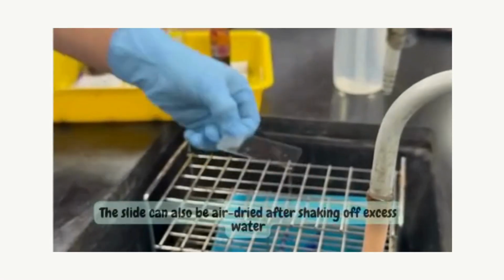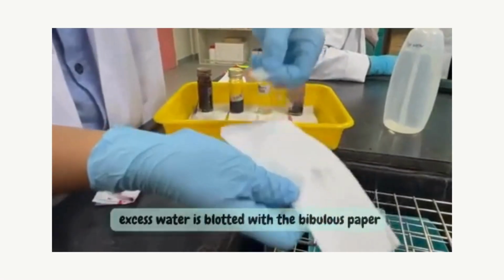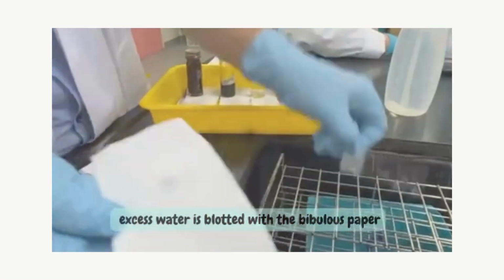The slide can also be air dried after shaking off excess water, and excess water is blotted with bibulous paper.